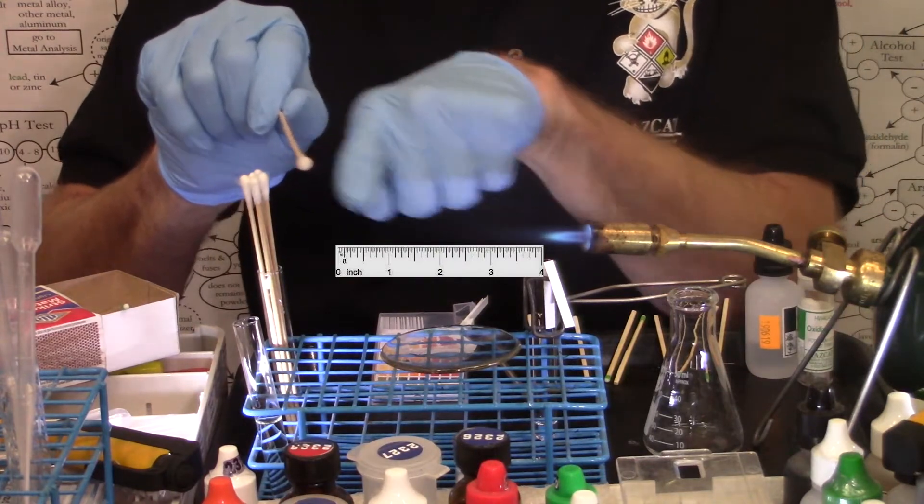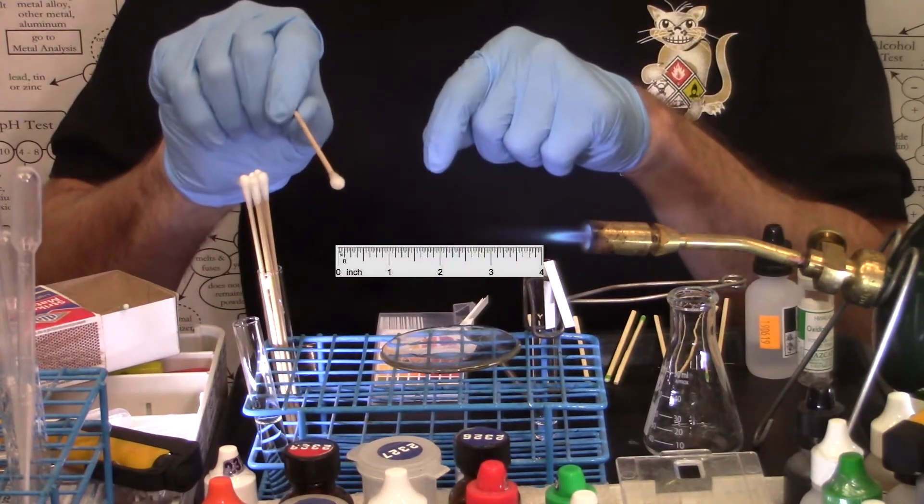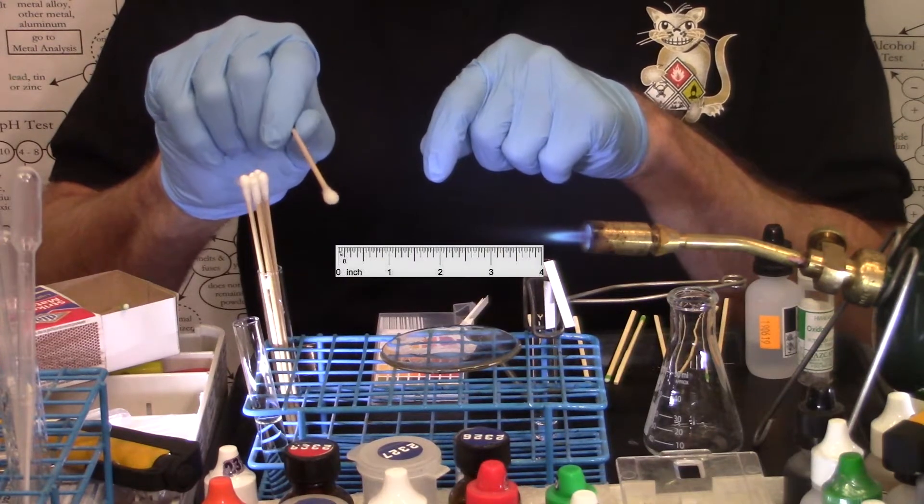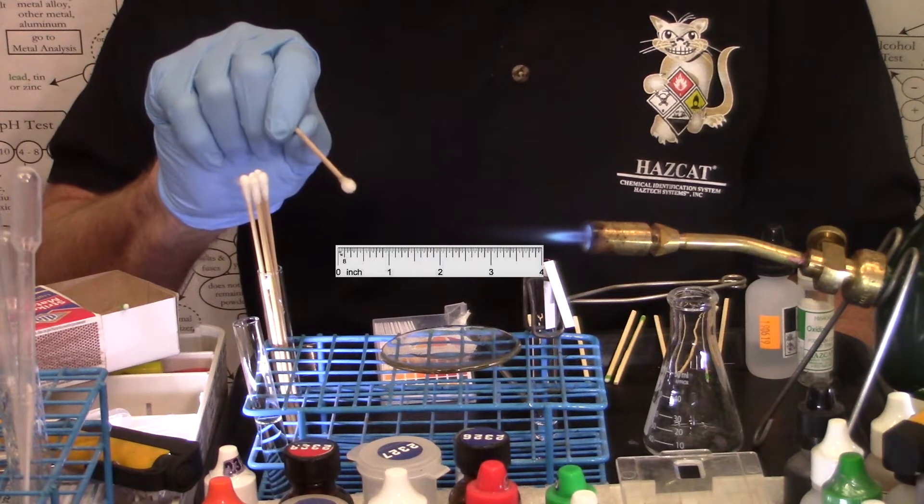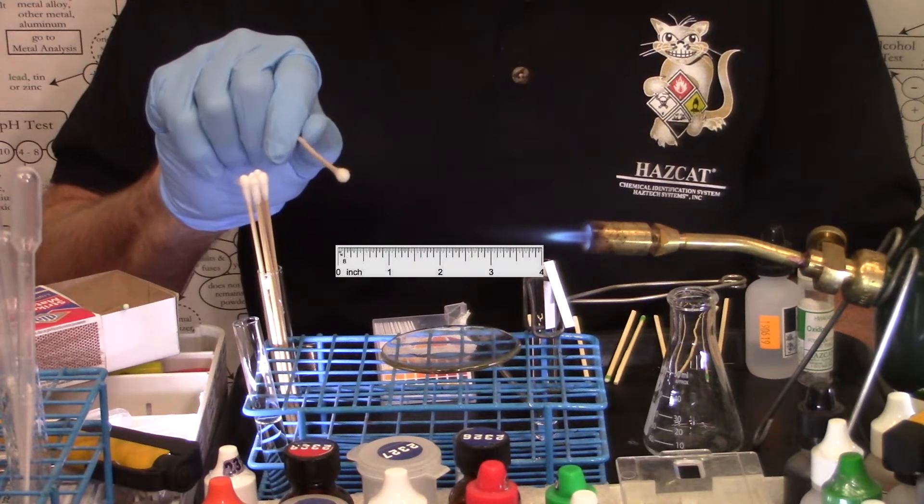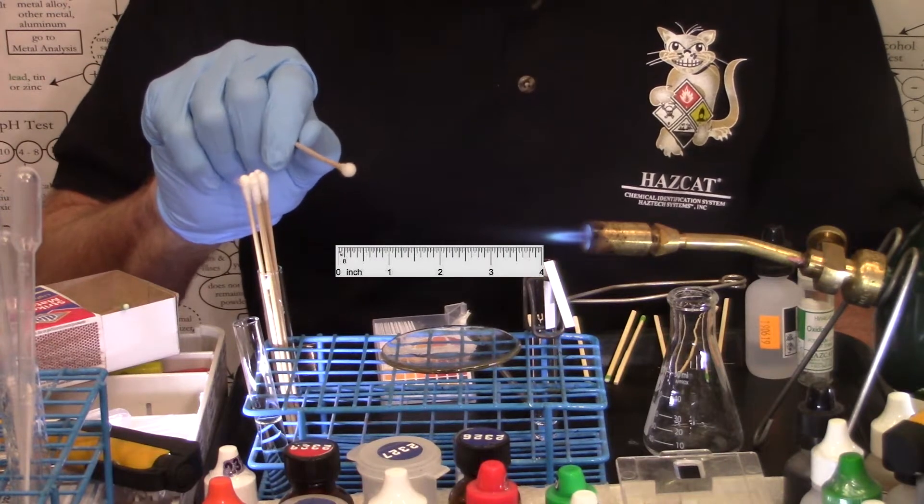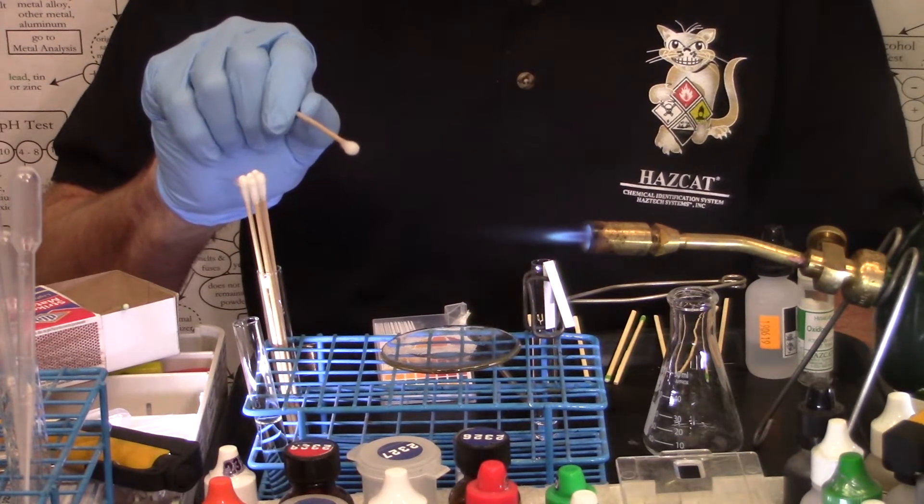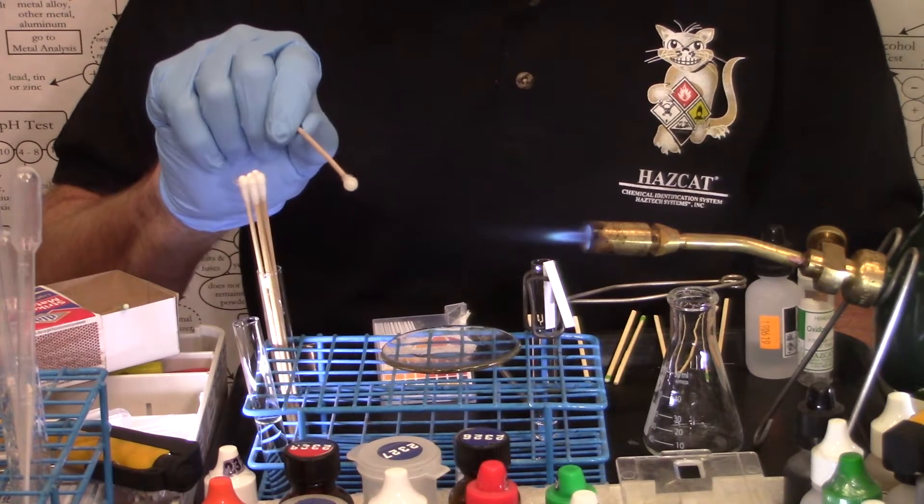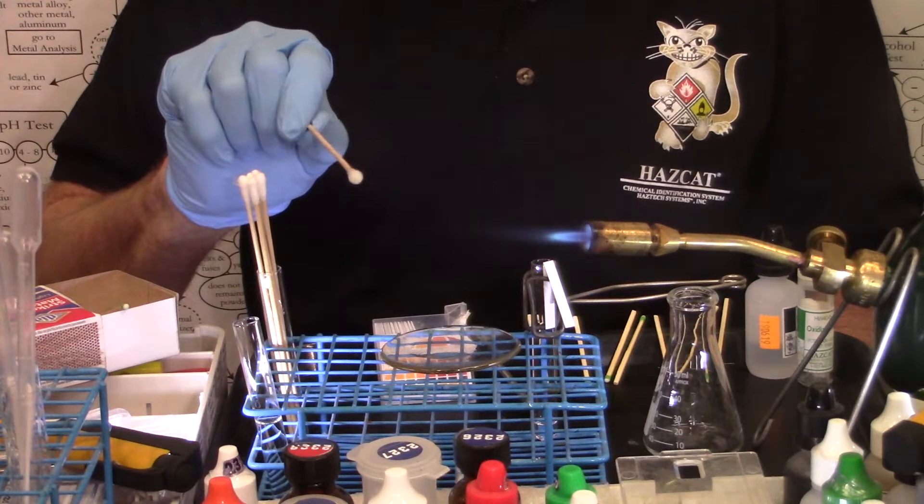About four inches away from the actual heat, I'm rolling the swab, I'm looking for energetic bursts of flame. I've had a little patience here, this could take a little while, especially if the unknown has some water in it, the water would have to evaporate off first before the unknown could start to react.